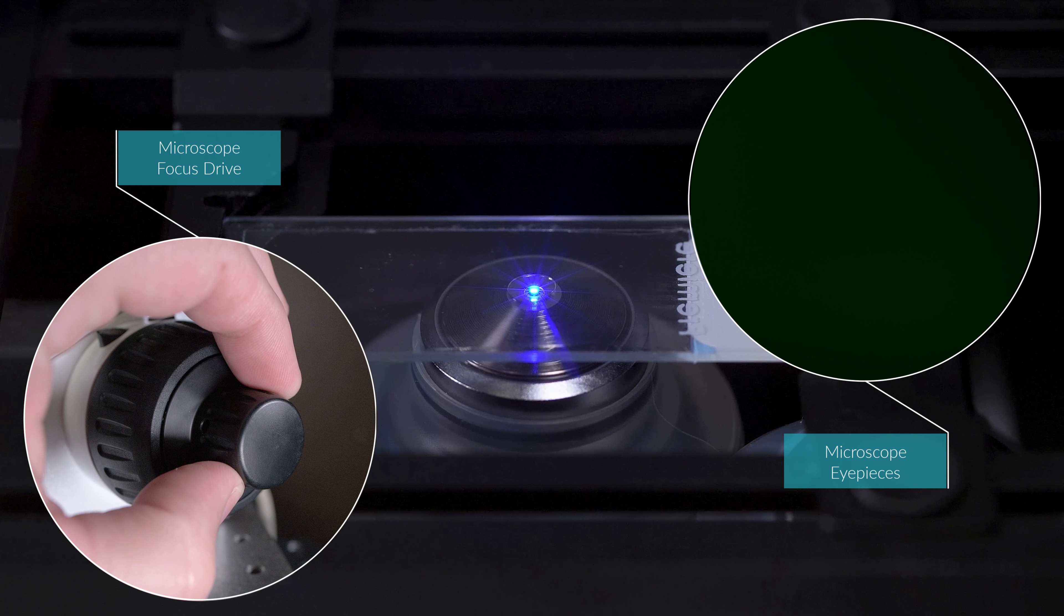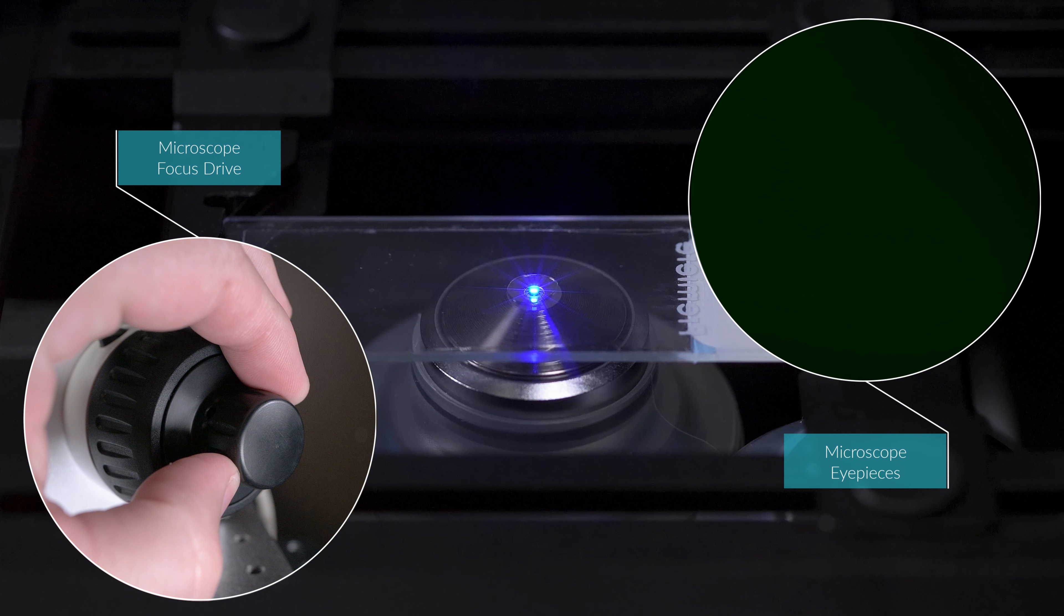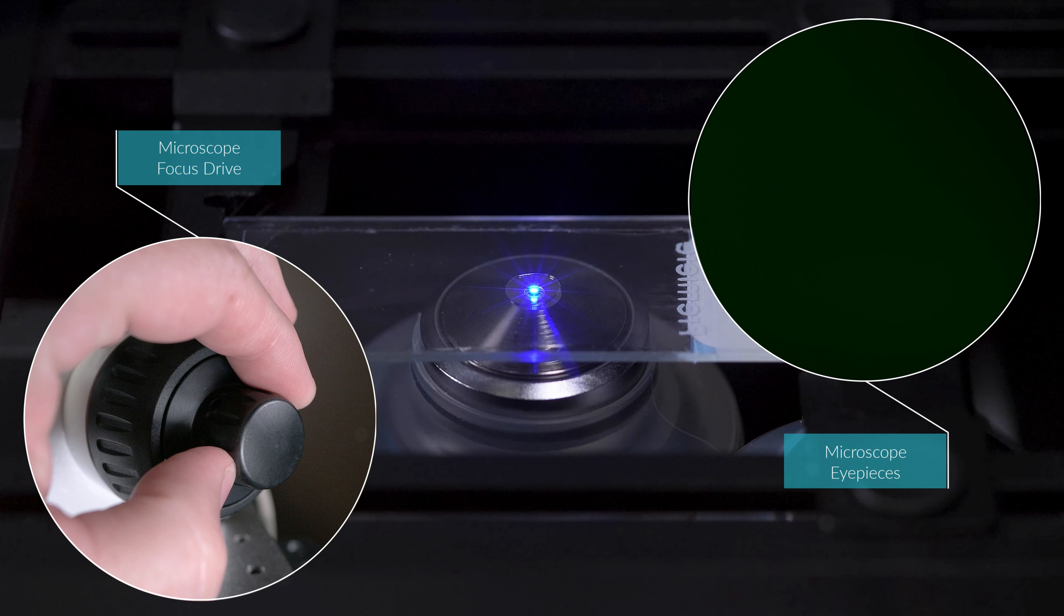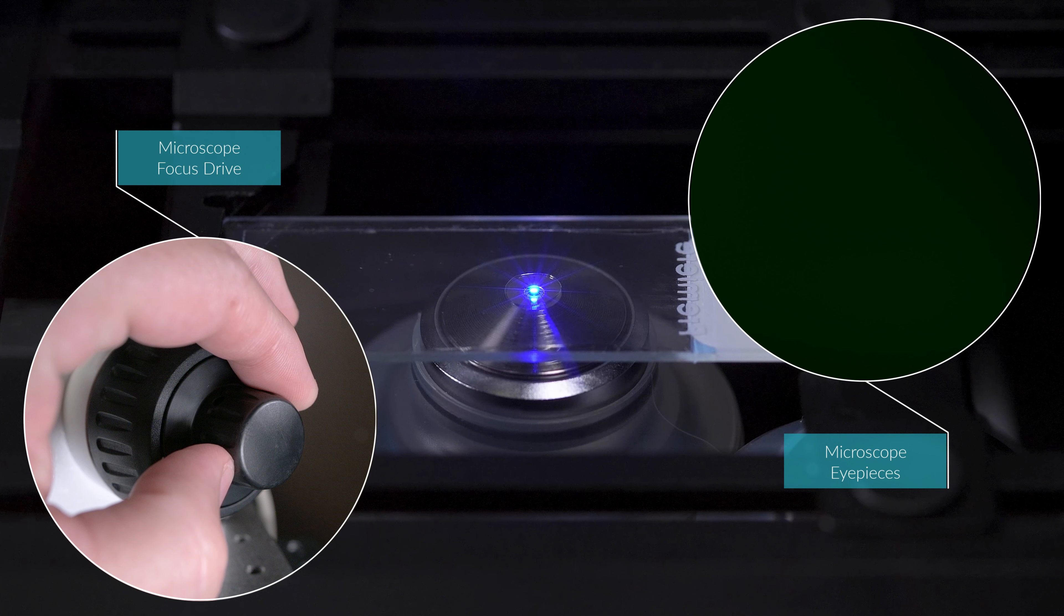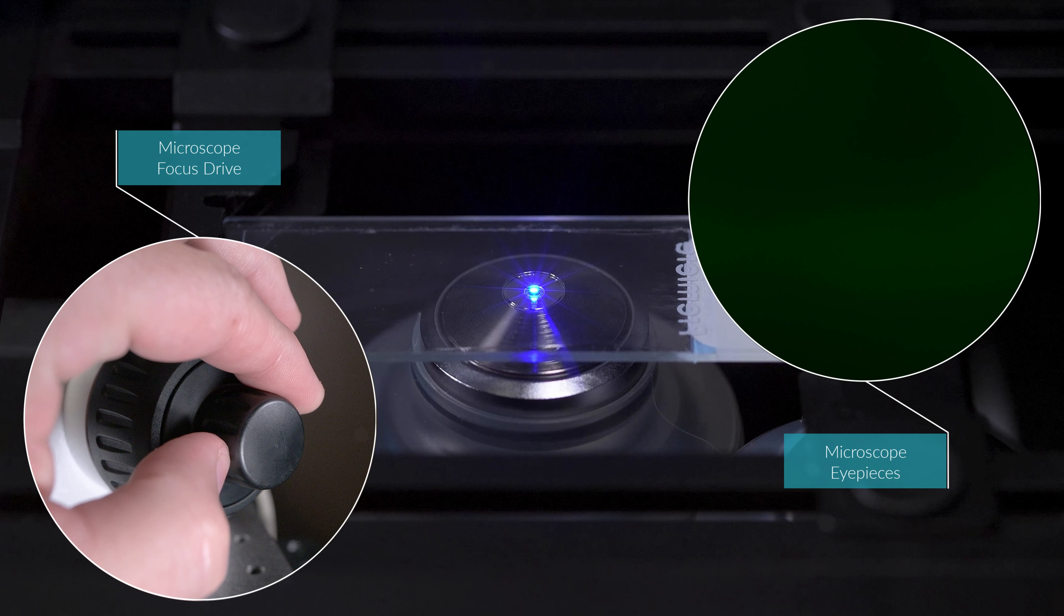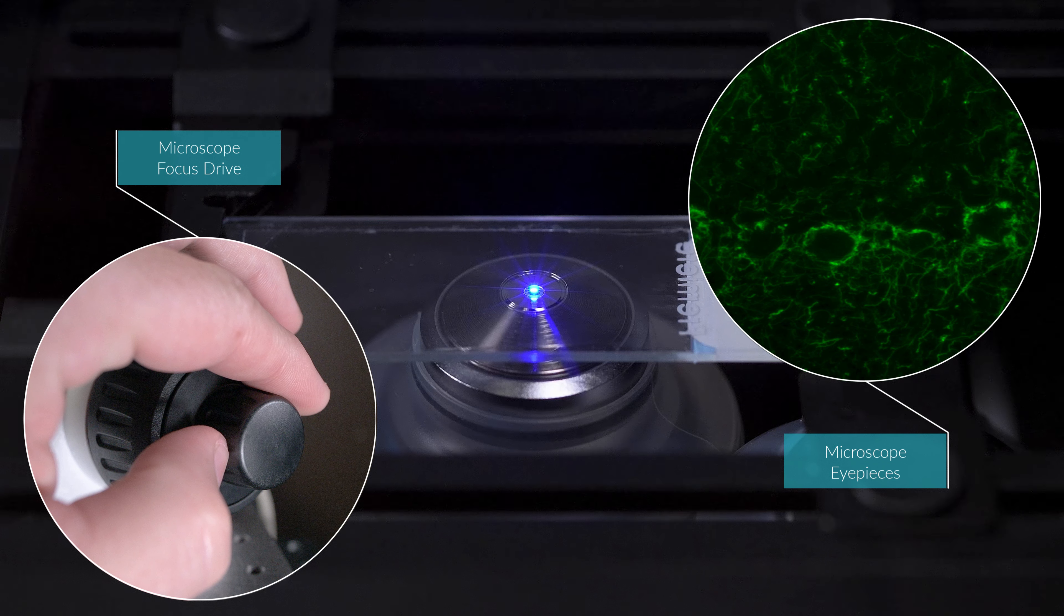Take a moment to pause and shift your attention to the microscope stage. Watch what happens to the oil drop as the objective gets closer to the cover slip. You should see this oil drop gradually expand as you focus closer. Back in the eyepieces of the microscope, you should start to see the outline of the specimen. Continue focusing until the image is sharp.